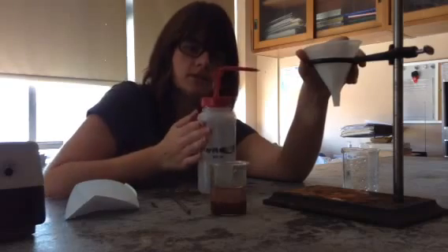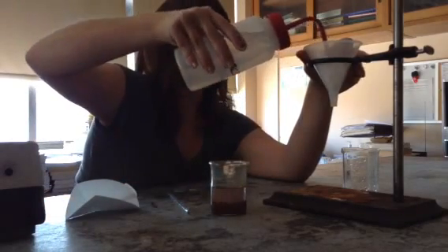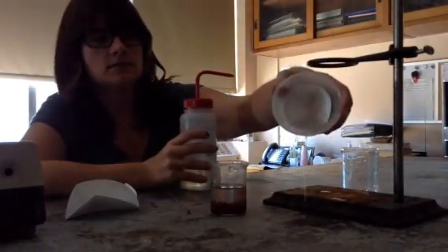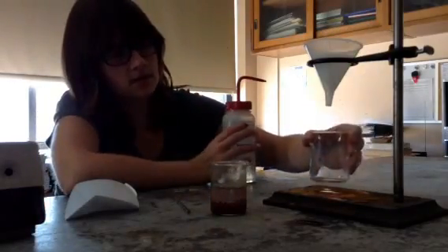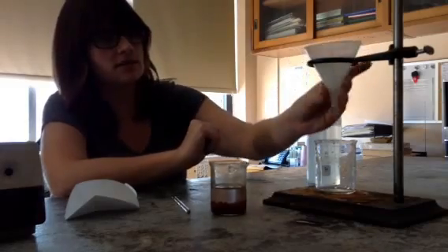I'm going to take a little bit of distilled water — that's what's in here — and kind of put it around the edges so that way it stays in place. The next thing I do is take my beaker and put an empty beaker under my setup.